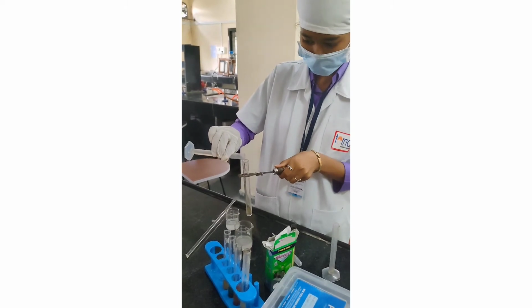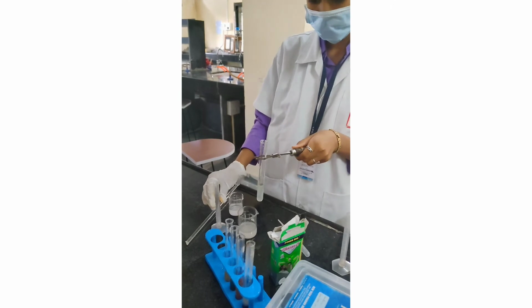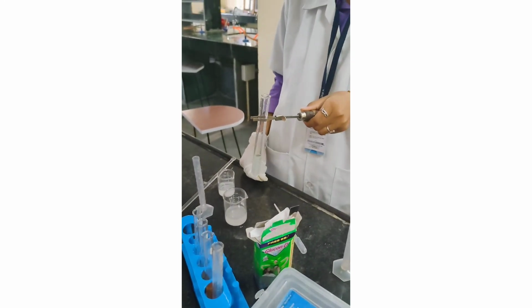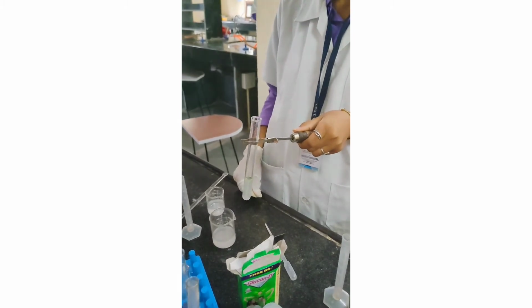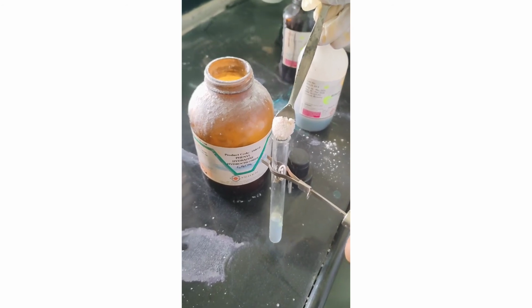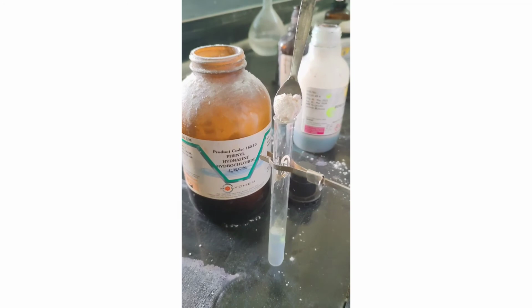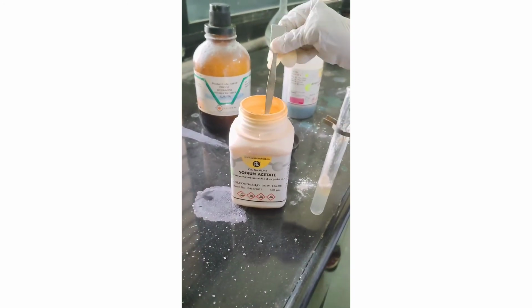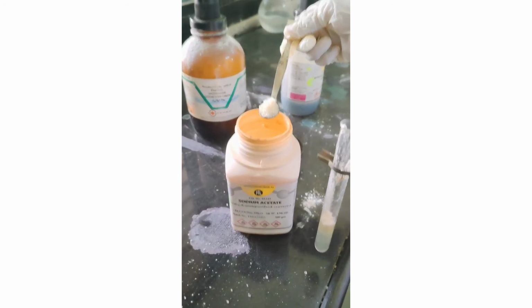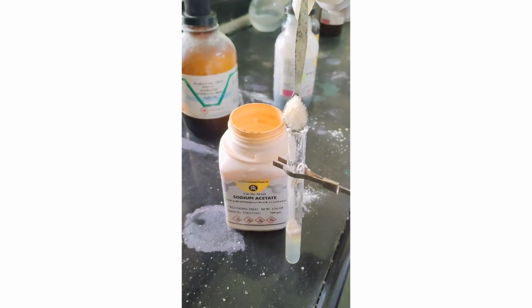For the final confirmation of the glucose, we take the Osazone test. It means the crystals are formed. For that purpose, we have taken 5 ml of sugar solution in our test tube. Now we are going to add phenylhydrazine hydrochloride. Half spatula of phenylhydrazine hydrochloride we are going to take in our test tube, which contains 5 ml of sugar solution. Then add double the amount of sodium acetate crystals. If we are taking half spatula of phenylhydrazine hydrochloride, then we have to take 1 spatula of sodium acetate crystals in our test tube.